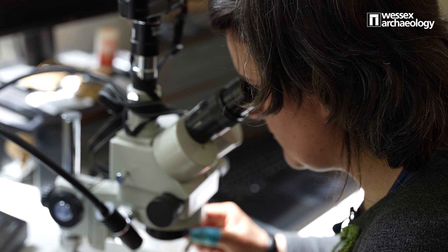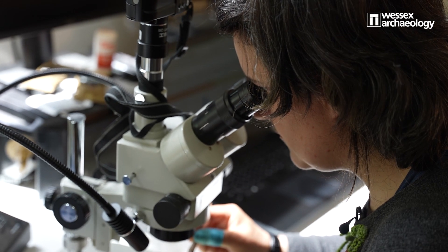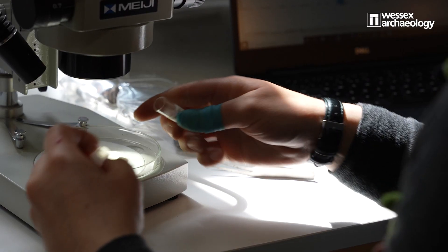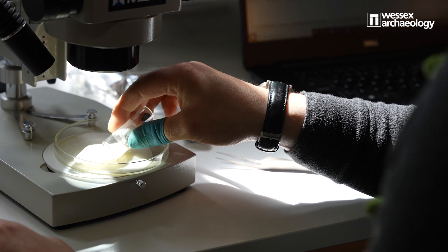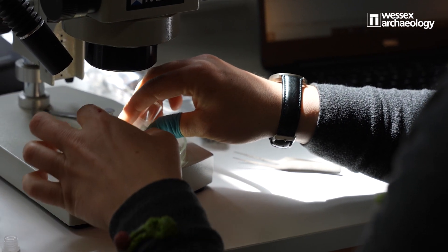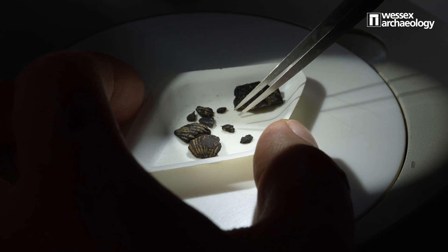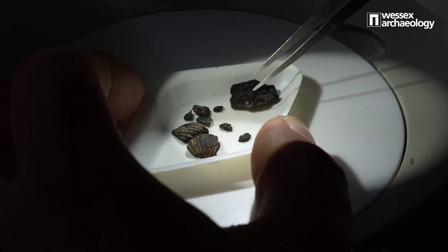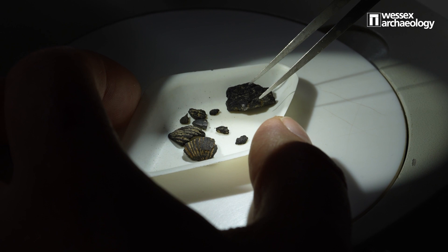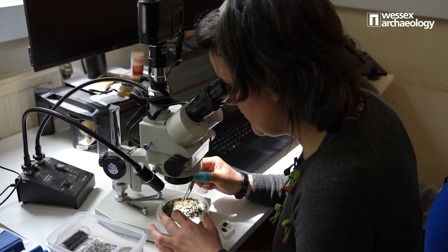We need to identify the material to be able to know what species were used in the past and how the landscape was. It's essential to use the microscope to be able to do the identifications properly, because with the naked eye you can probably see charred plant remains but you cannot tell exactly what it is.